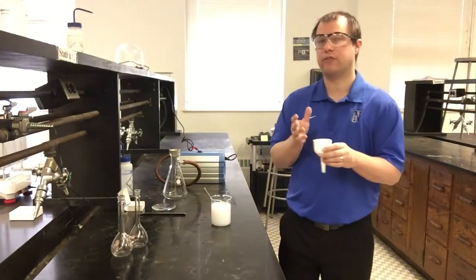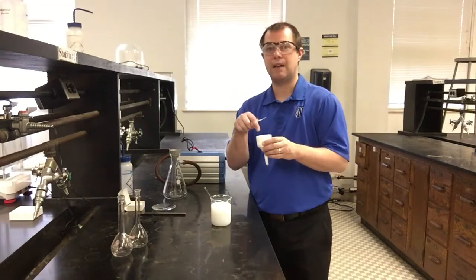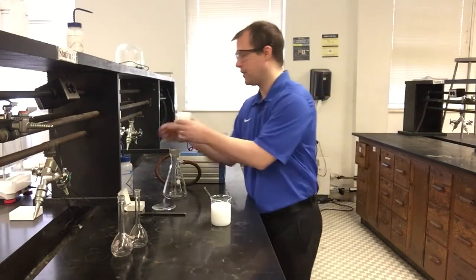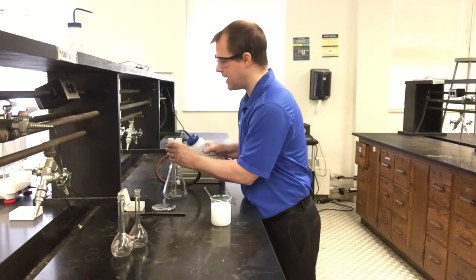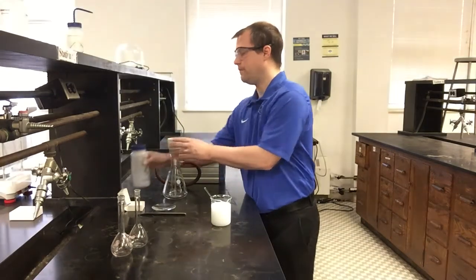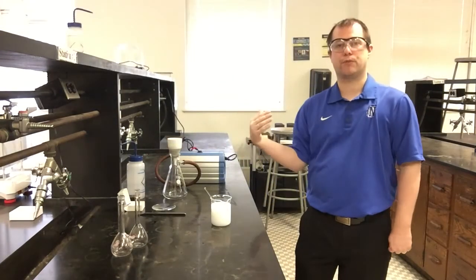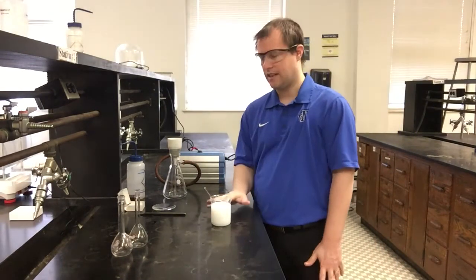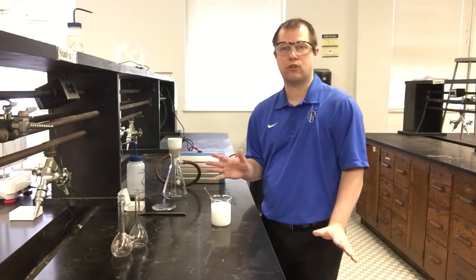Now, like I did for the previous time I did a filtration, I'm going to wet this just a little bit so that it makes a nice seal between the filter paper and the funnel itself. So I'm going to add just a tiny bit of water to this so that the sides of the filter paper are kind of sealed down nicely. Because all of that water hopefully is going to come through, and we're going to dry it off here when we're done in an oven anyway. So adding a little bit of water that's not part of our solution shouldn't affect anything for our filtration.